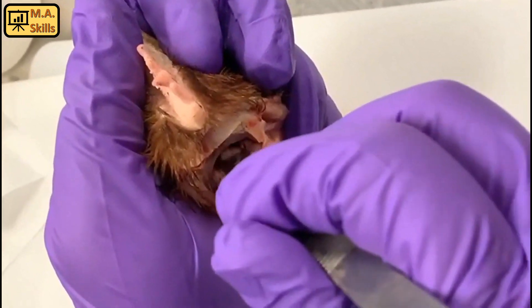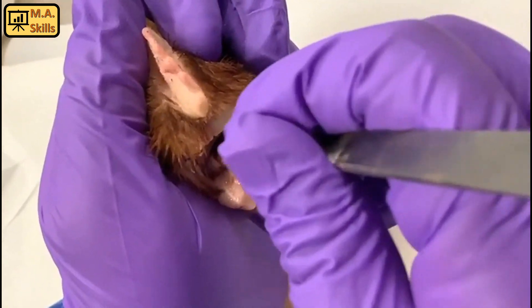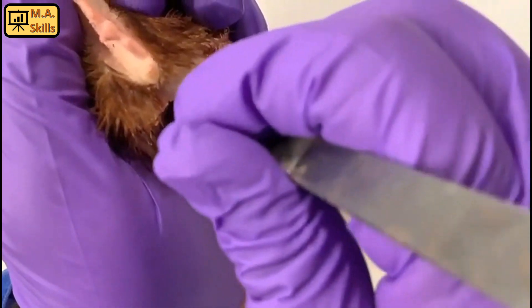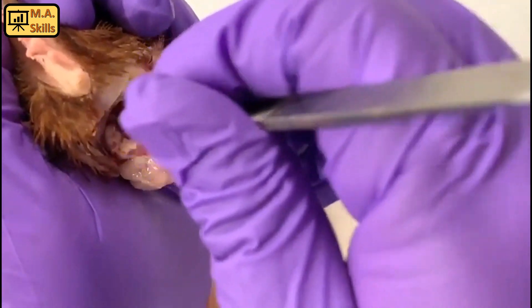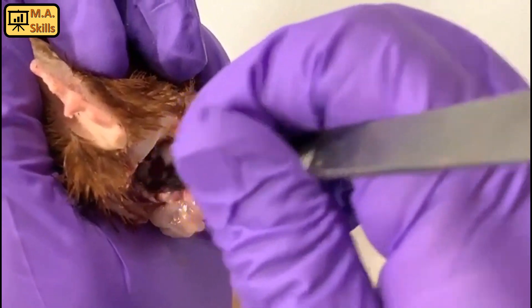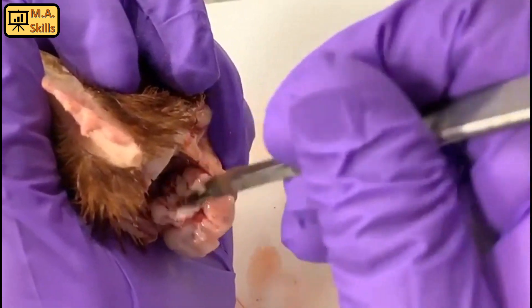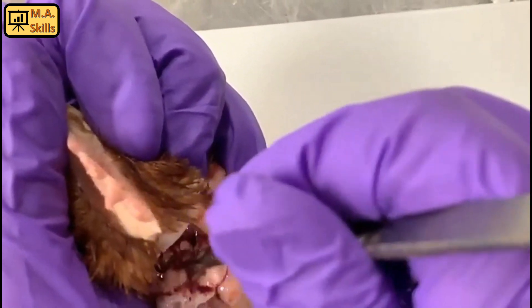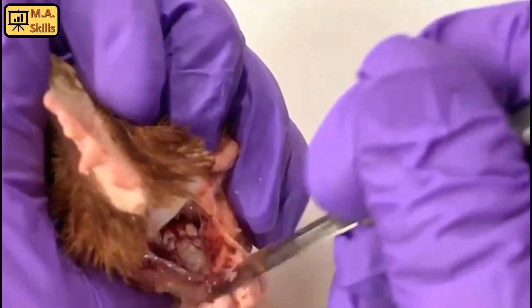The hypothalamus is located just behind that optic nerve or optic chiasm. What I'm doing here is just pulling out the whole brain, and then we're going to cut the cerebellum because we don't need to take samples from the cerebellum.